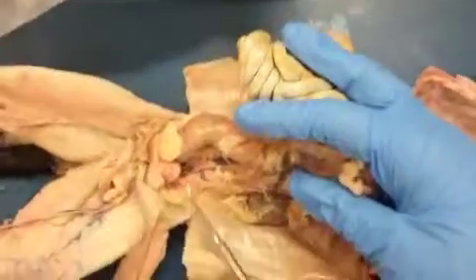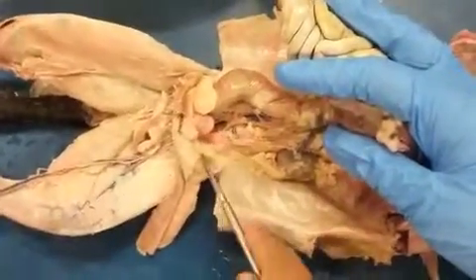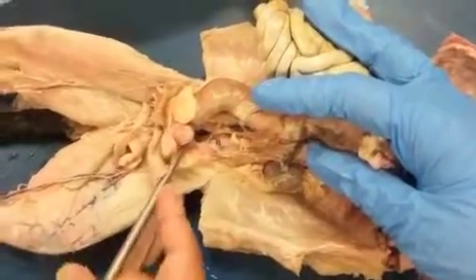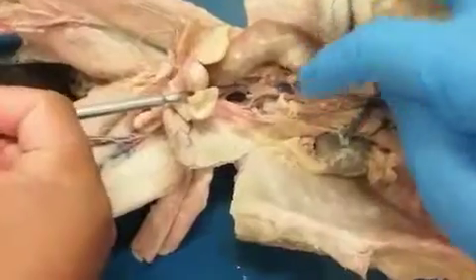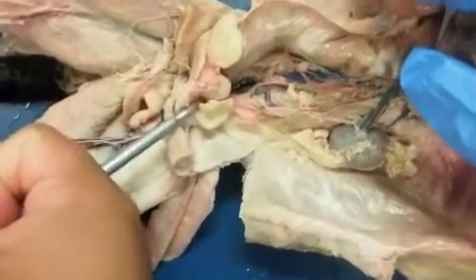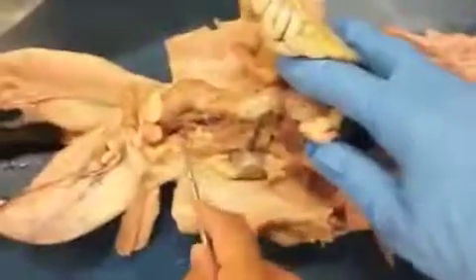But the artery, there isn't a common iliac? Not in cats. And in humans, it would have that same anatomy as the picture of the veins there. But what you see here where the probe is, that's the common iliac vein. The deep one, right? Yeah, that big blue vessel that's right there. That's going to be that guy. So you have a left common iliac and a right common iliac. They come together, and they eventually drain into the inferior vena cava.